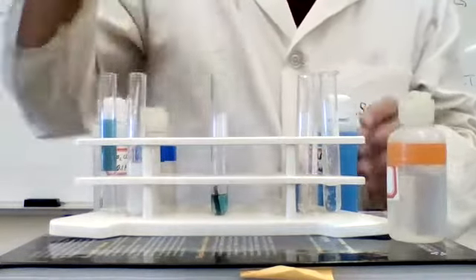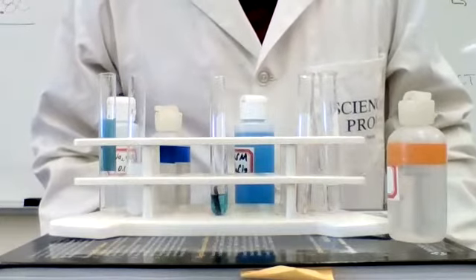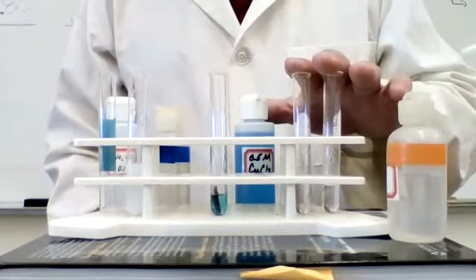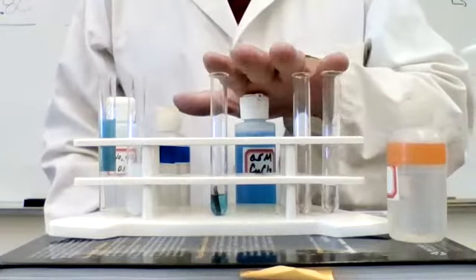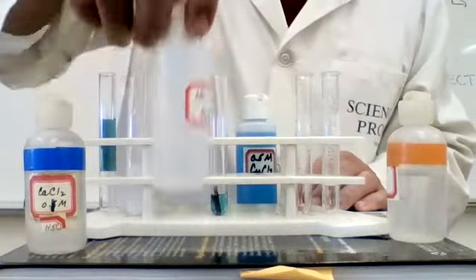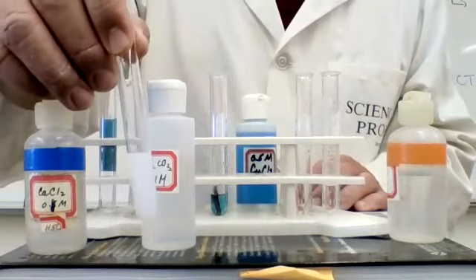So these are just some reactions, demos that just sort of help reinforce the idea of predicting products and types of reactions. And again, for single replacement reactions, like what we had here with the hydrochloric acid and the magnesium and copper, the copper chloride with iron, what you need to do is you need to check the activity series. When you have double replacement reactions, like in this case, calcium chloride with sodium carbonate, what you need to do is you need to check the solubility table to see what precipitate forms.